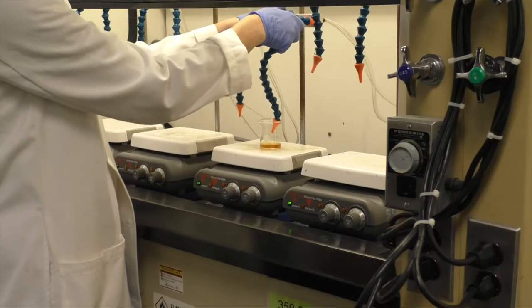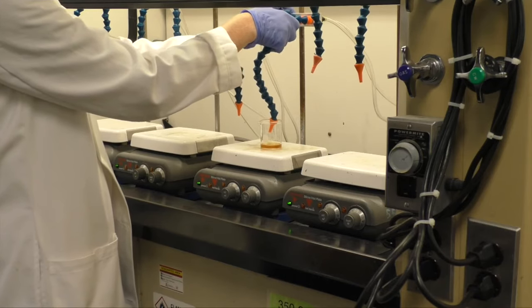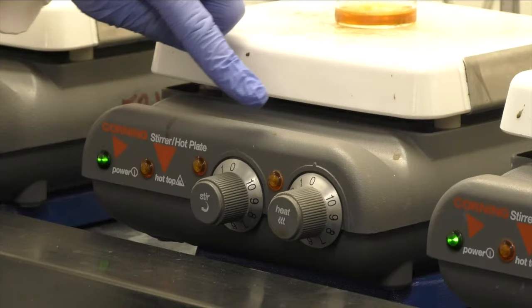Use the blow-down station to remove any remaining ether. Notice that stirring and heat are not needed. The air alone will remove the ether.